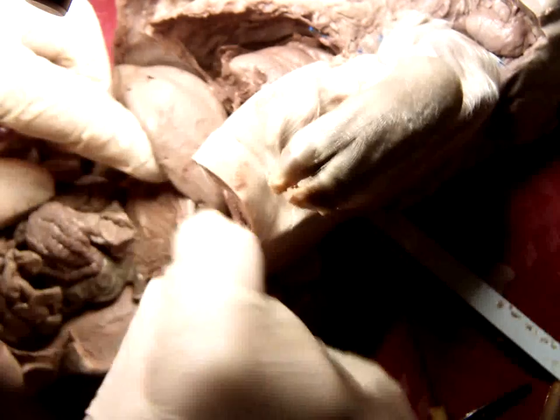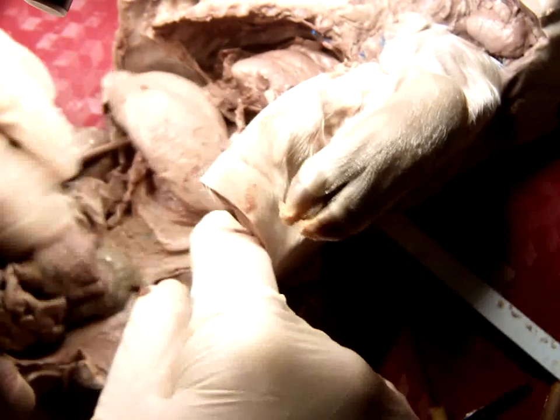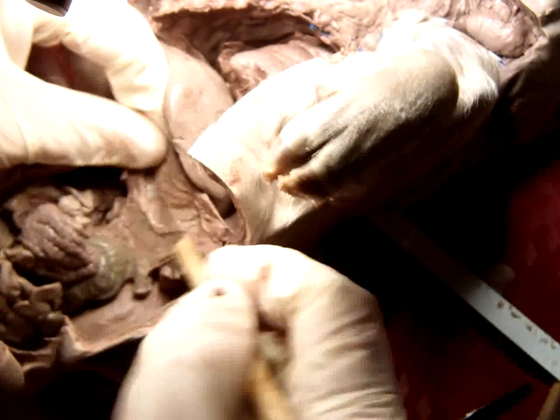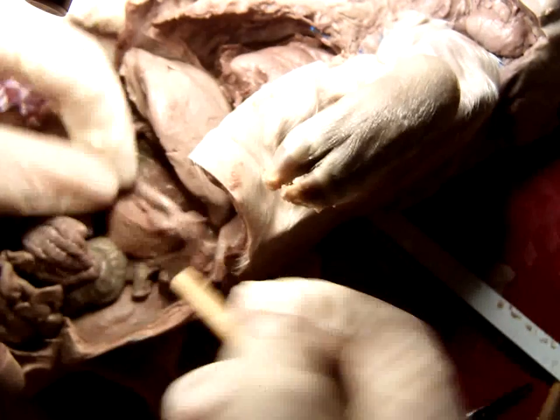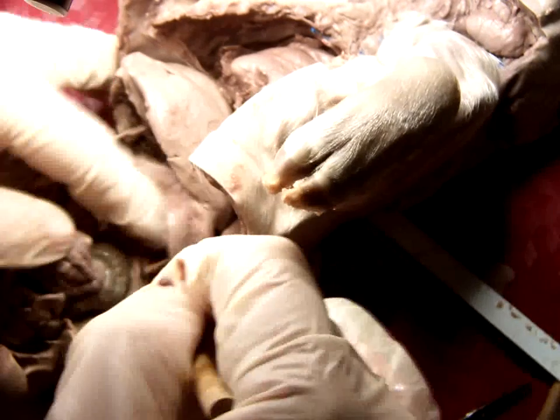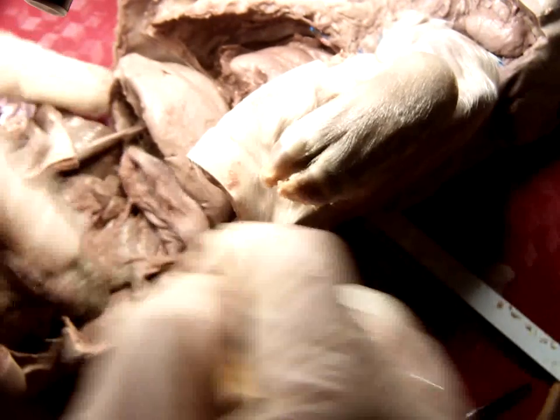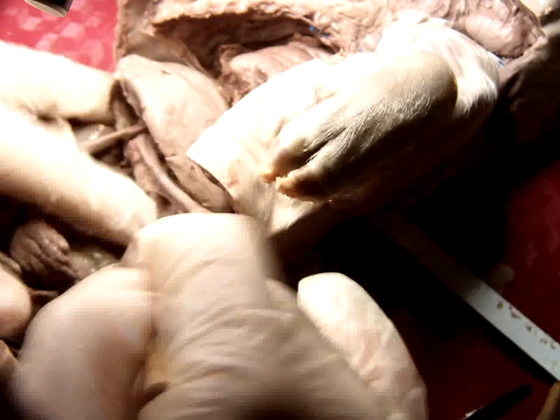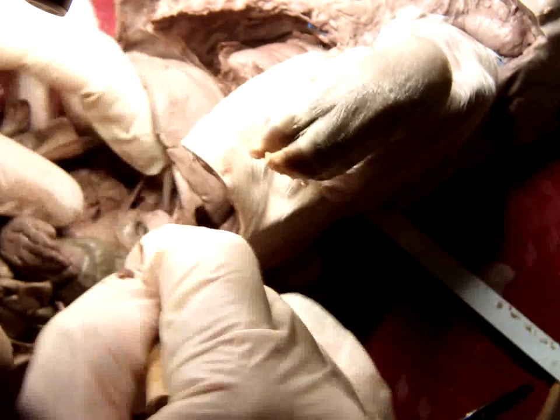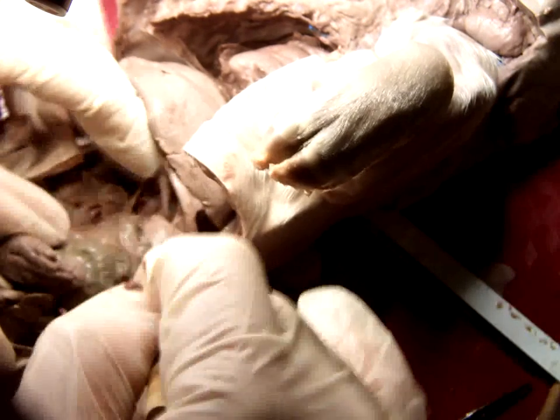Now on the underside of the stomach, we've got kind of a mess here. I'm going to trim away a little bit of this peritoneum, because what I'm looking for is probably housed herein. What I'm looking for is the pancreas, and the pancreas looks a lot like cottage cheese as far as texture. I wouldn't count on the color.